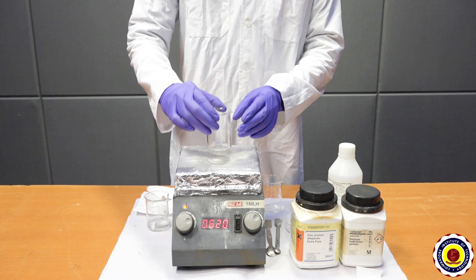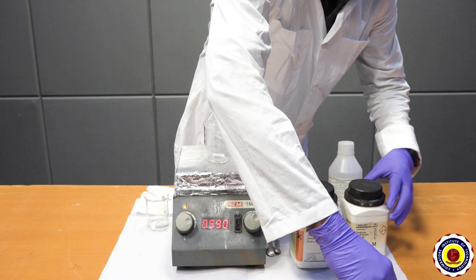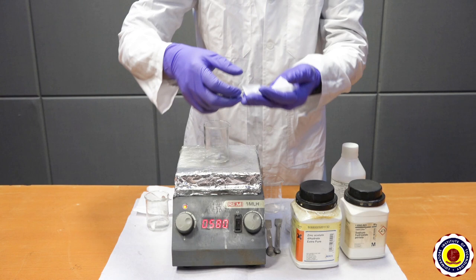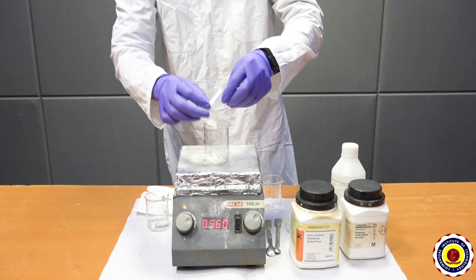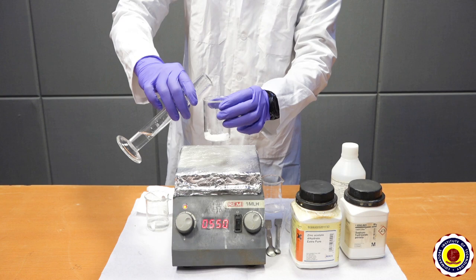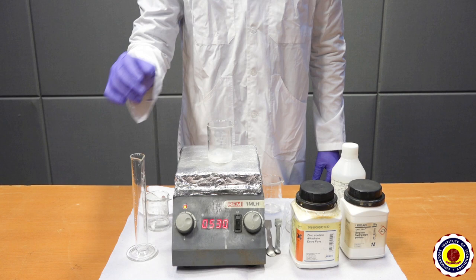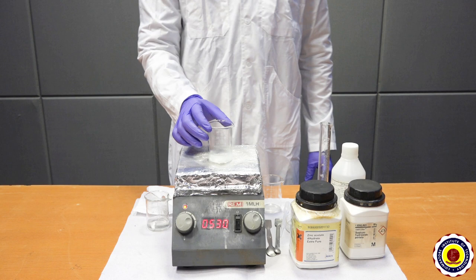Now take a second beaker. Add 5 grams of sodium hydroxide and pour 10 ml of distilled water inside the beaker. Stir the mixture constantly for 5 minutes and leave it to produce sodium hydroxide solution.